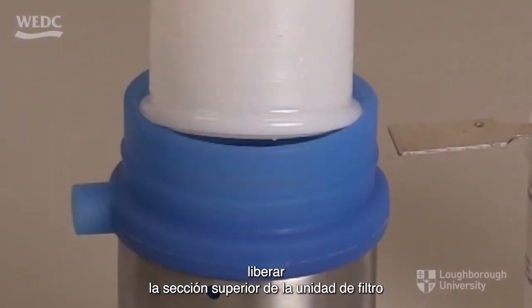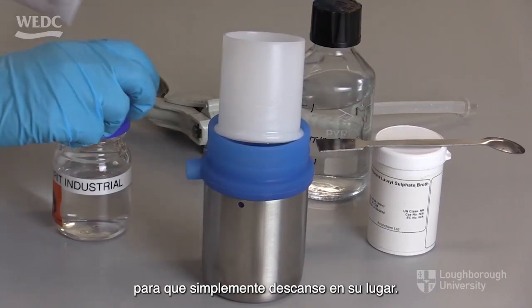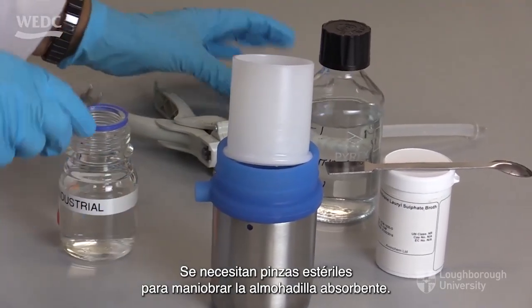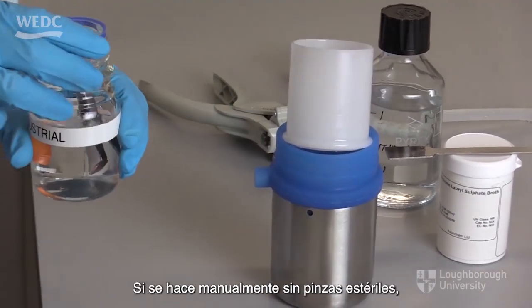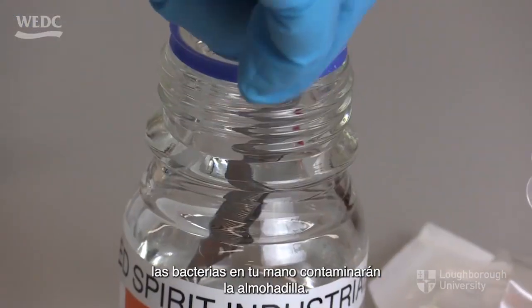Release the upper section of the unit filter so that it is just resting in place. Sterilised forceps are needed to manoeuvre the absorbent pad into place. If this is done manually without sterile forceps, bacteria on your hand will contaminate the pad.